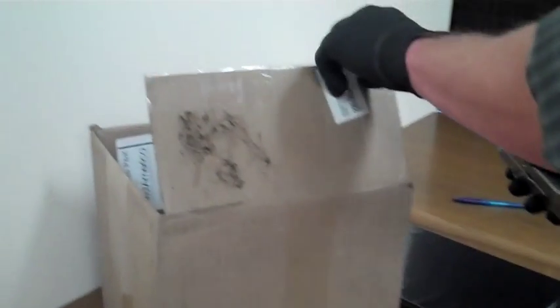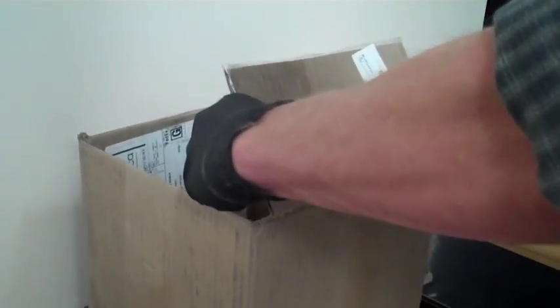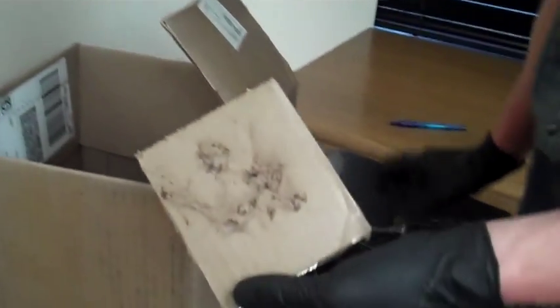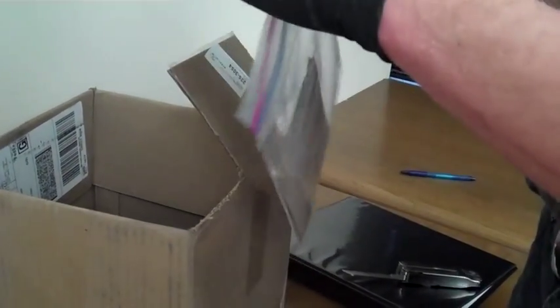However, bulk sampling is not always feasible as the material that the mold-like growth is attached to must be cut or damaged to collect the sample. In this scenario, we have simulated mold-like growth on a box. A piece of the impacted box is cut and removed and the bulk sample is then placed into a bag for shipment to the lab.